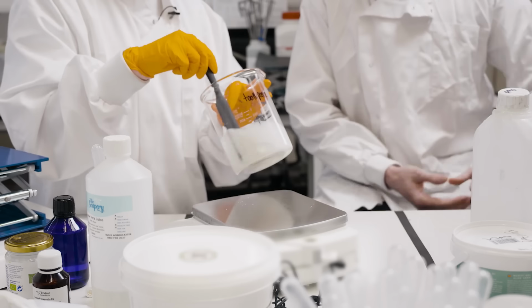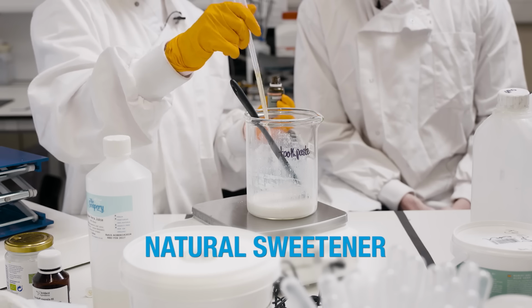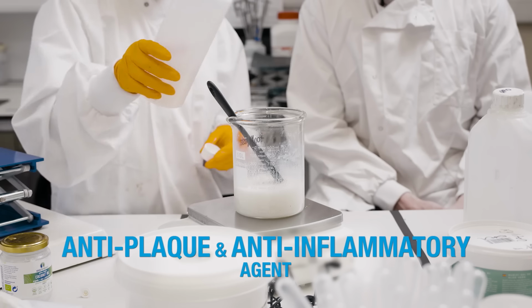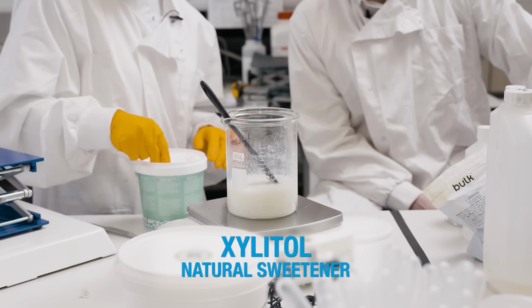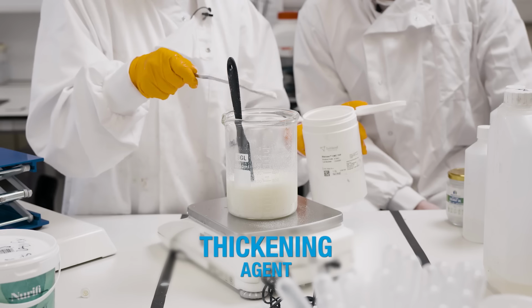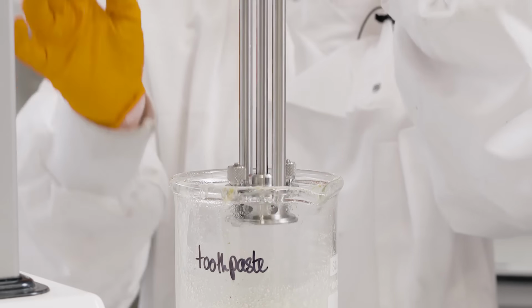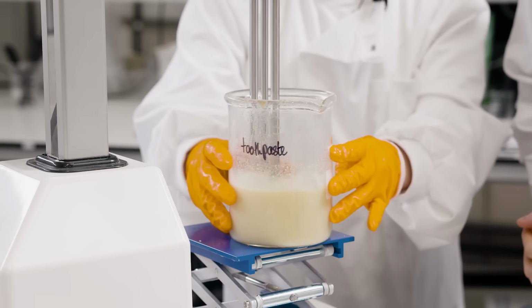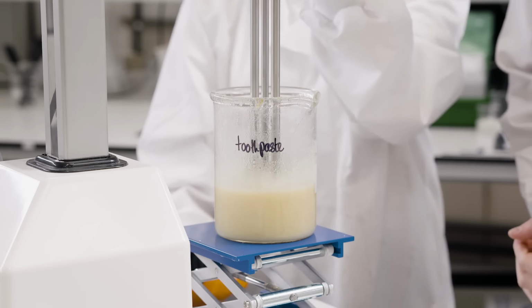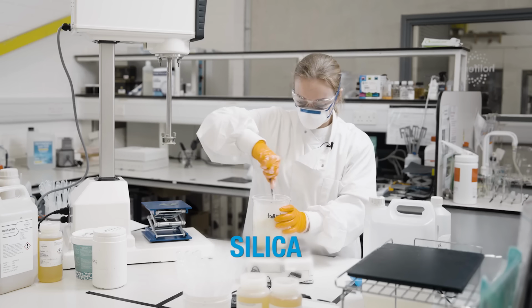Well, toothpaste is a very high viscosity product with complex rheologies, and it's a solid suspension as well. So it'd be great today to see how the Silverson L5 machine tackles this challenging mixing task. So I love the Silverson for this application because, as always, it's saving me a whole bunch of time. So the first stage when I use the Silverson, I'm using it to increase the dissolution of our Sorbitol and Xylitol. And then the final step is adding my silica to the toothpaste.